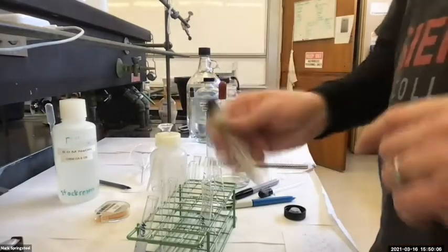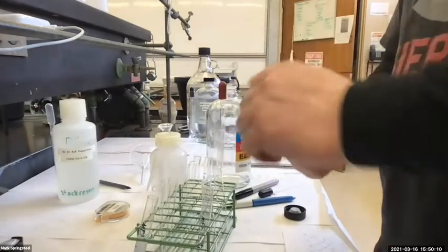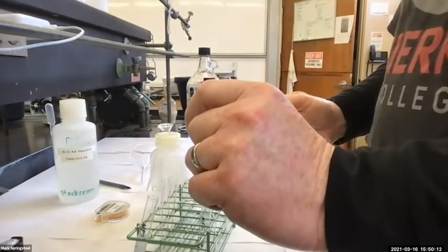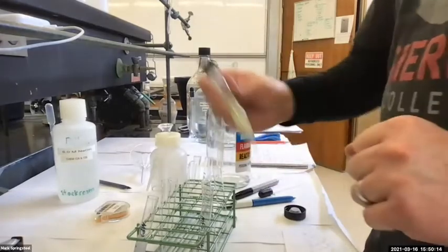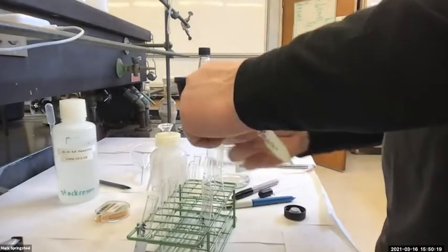If you're doing an extraction where a reaction takes place that creates a gas, then you have to worry about venting. Like if you're using sodium bicarbonate to quench an acid, it creates carbon dioxide gas, then it can really vent. So you've got to be careful with those.